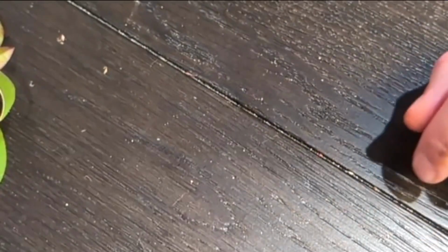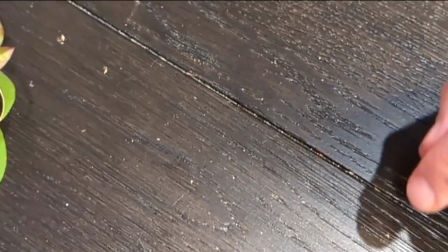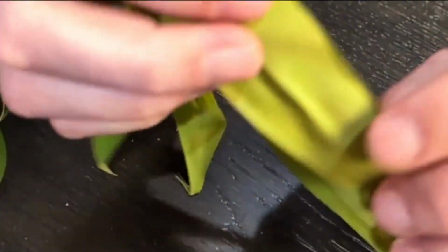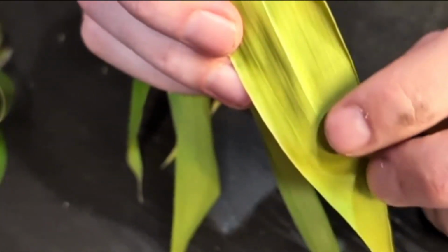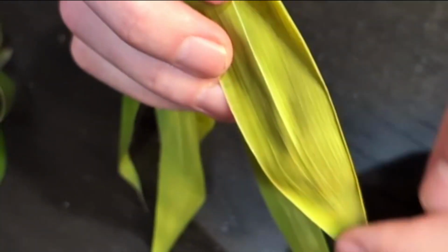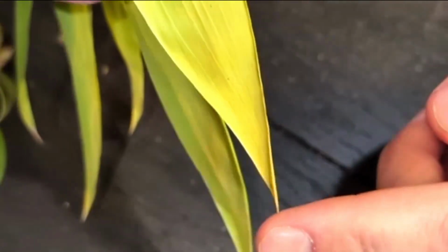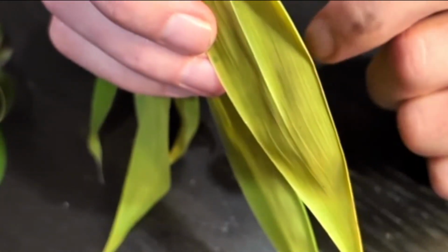Okay, so now we'll move on to venation. So we'll start off with parallel venation, that bamboo plant. So we're going to zoom in a little bit more on these ones. Maybe I can look back here, try and get that really in focus there. There you go. You can see the veins, and you can see how they all run from the base of the leaf up here to the apex, and they all run together. So they'll start at the base, and they'll culminate at the end of the leaf here, and they all run parallel that whole way. That's a parallel venation pattern.